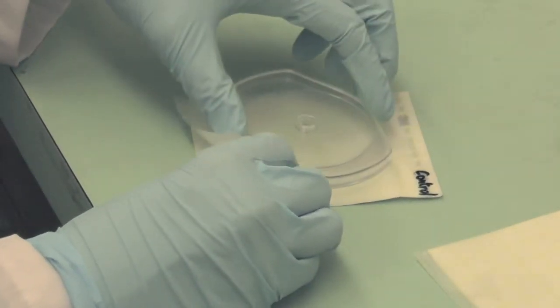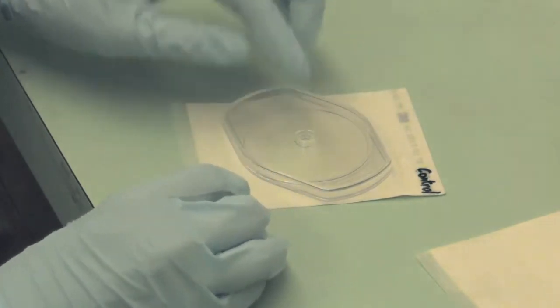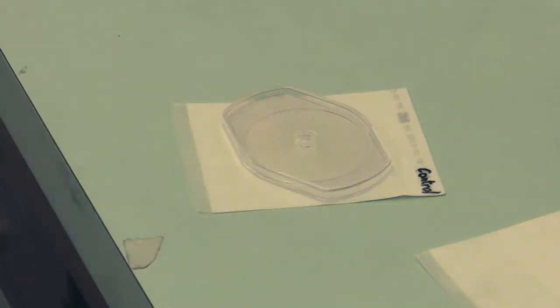Place the plastic spreader gently on the top film with the ridge side down over the inoculum so the sample will be distributed evenly into a circle. Remove the spreader and leave the plate for 10 minutes for the gel to solidify.